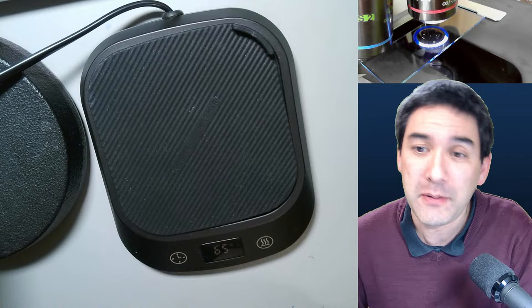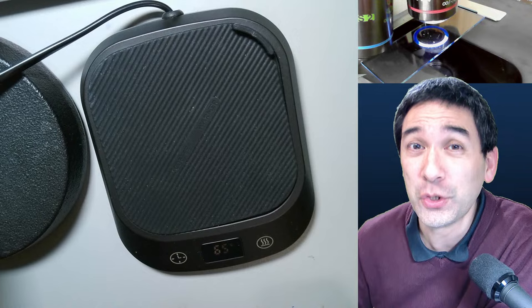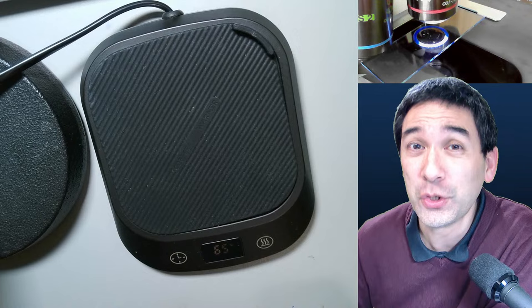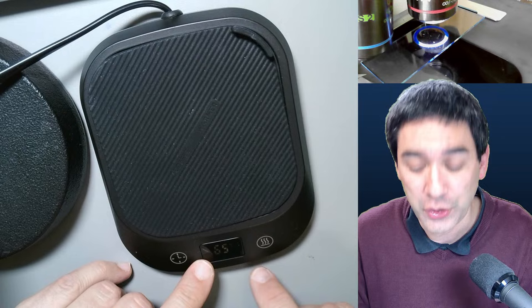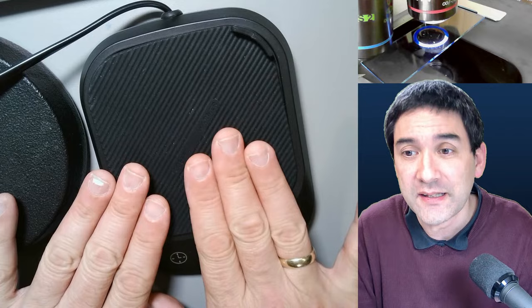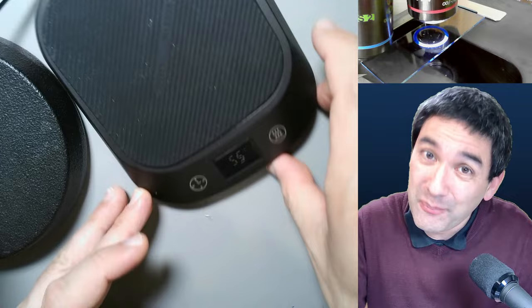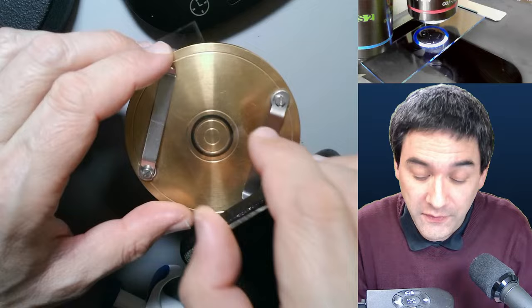The coffee warmer proves to be very useful for making ringed microscope slides and for growing crystals so we can observe them under the microscope. I'm going to show you this, and then a couple of videos of what some other people made. This here is called a slide ringing table — there are also possibilities to make this yourself. You spin it and carefully apply the nail polish to make a nice little ring.